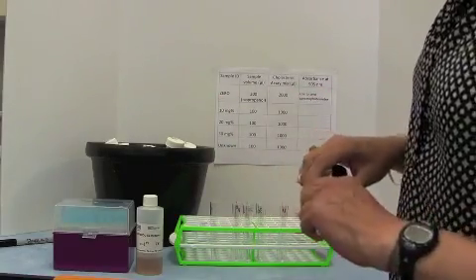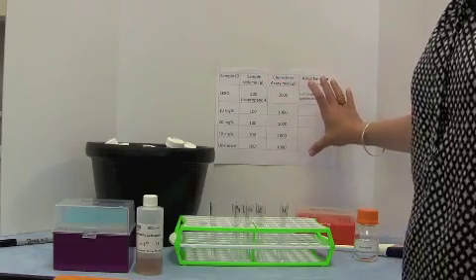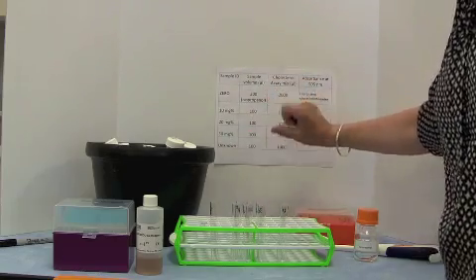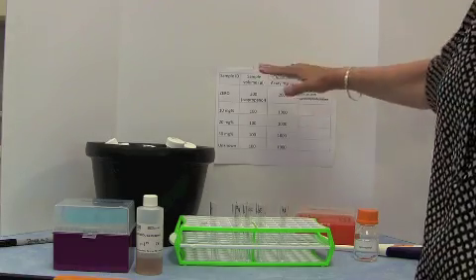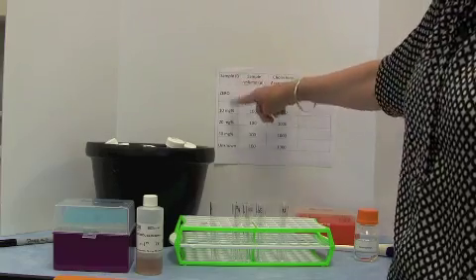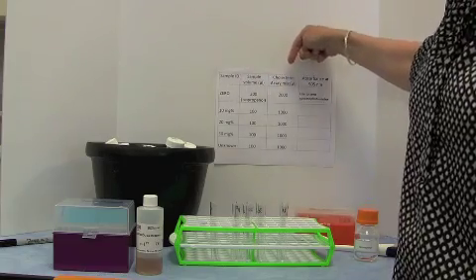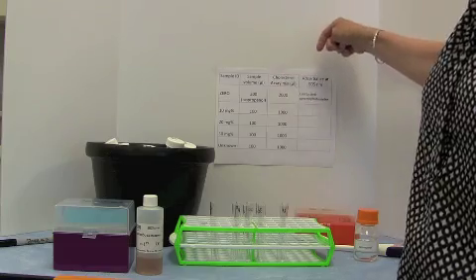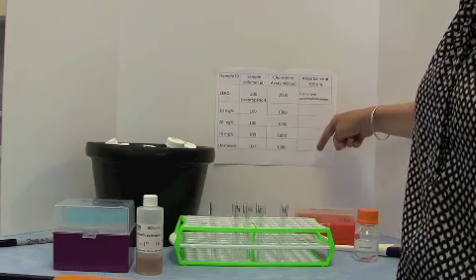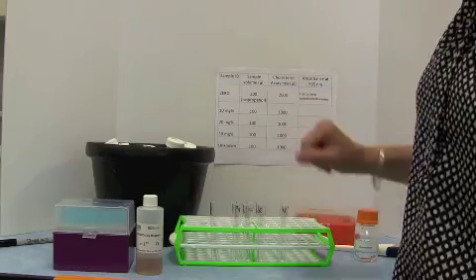You will also have, printed off, the pipetting table for setting up this assay. This will be in the materials on Web Campus, and we have a number of columns here: what is the sample, how much of the sample we add, how much cholesterol assay mix, and a column for recording the absorbances of the samples. We use this as our guide for what we're going to pipette.